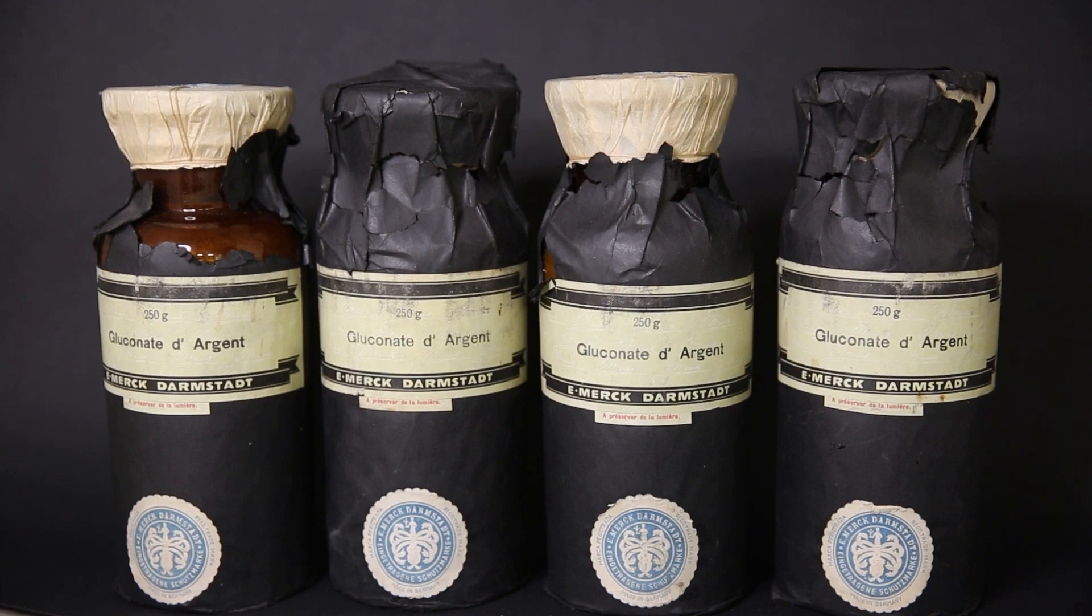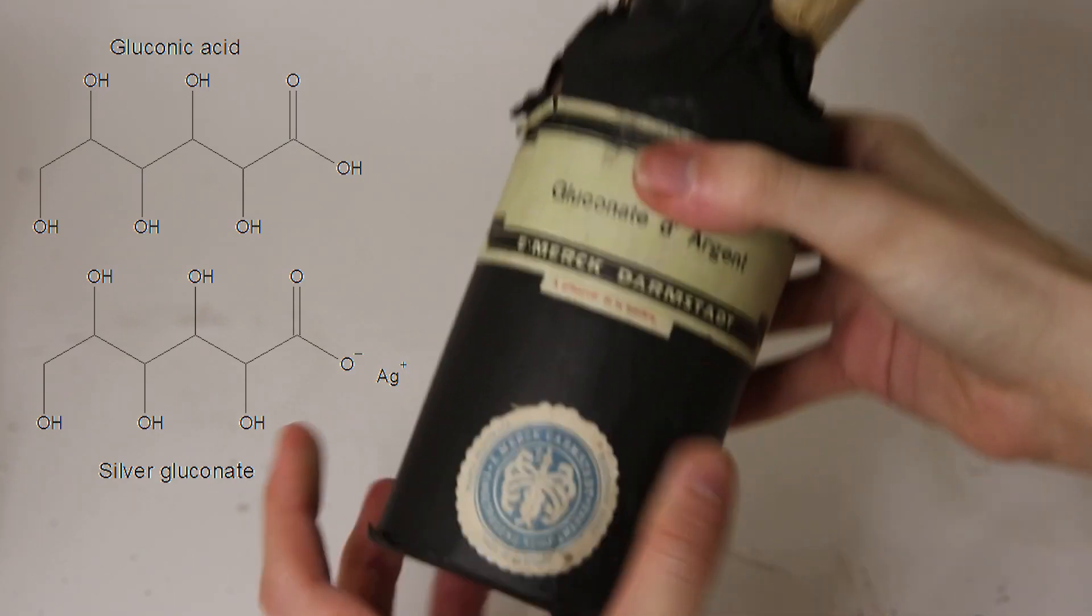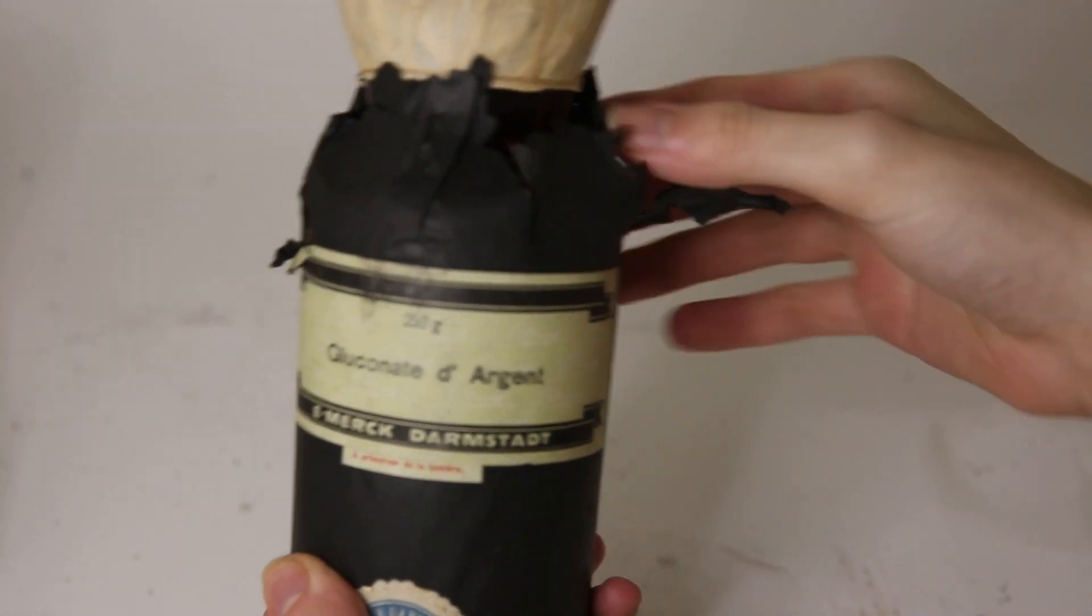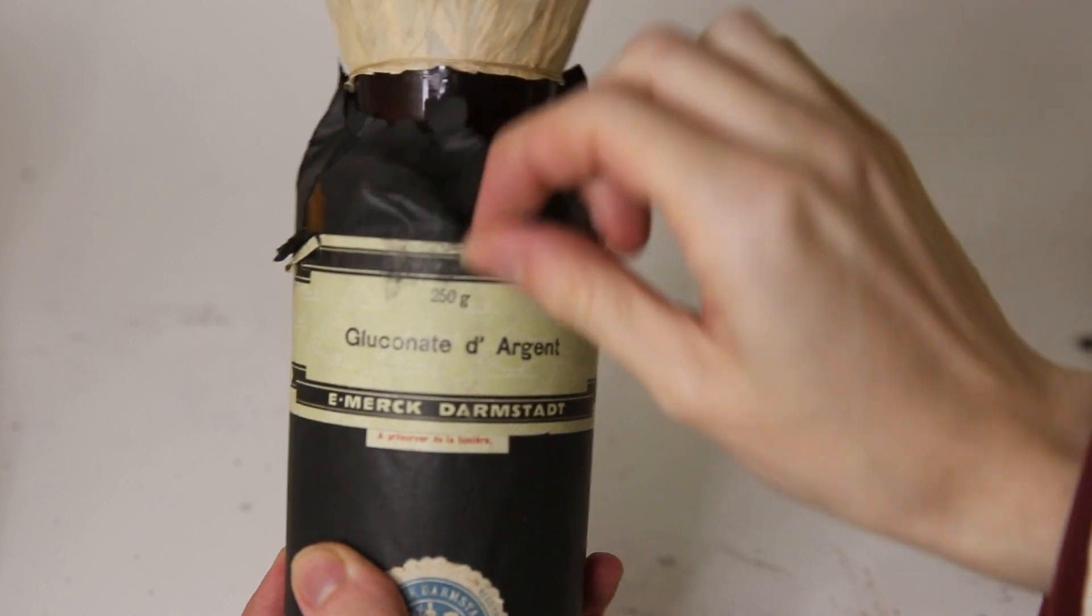So let's just get into opening them and see what's inside. They are still fully wrapped in protective paper and are also sealed pretty well, so I'm sure that the original content is still in here and hasn't been tampered with or refilled.